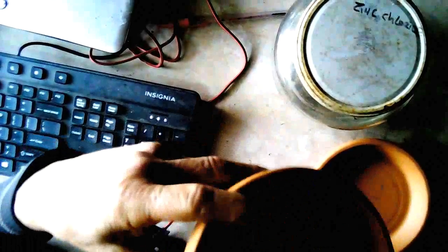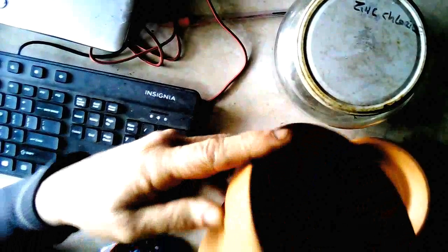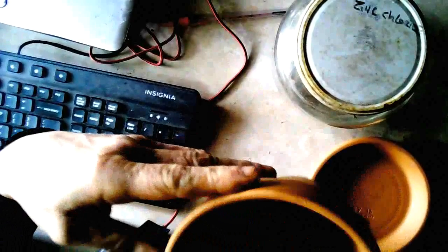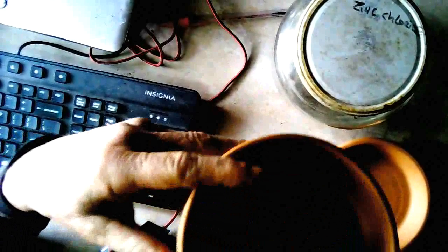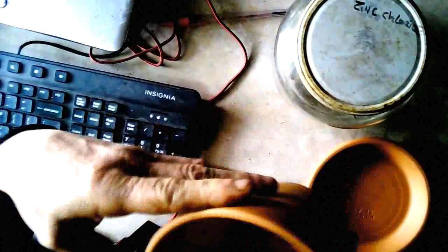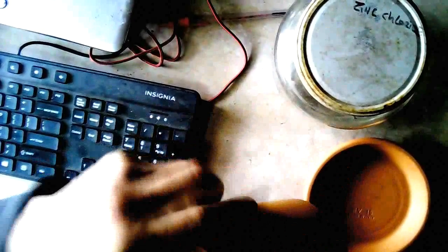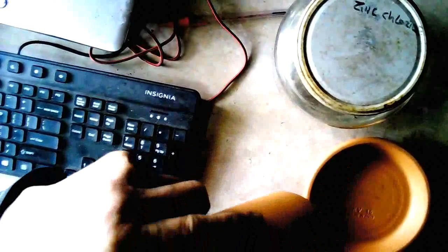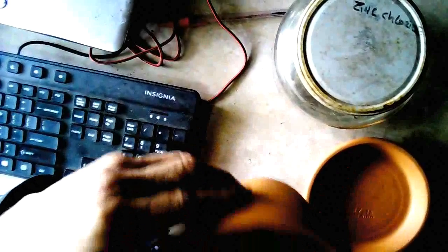And you know what happens when you put metal inside of a microwave oven, right? So this is going to get extremely hot and should make a great kiln. The zinc will be right in the clay.